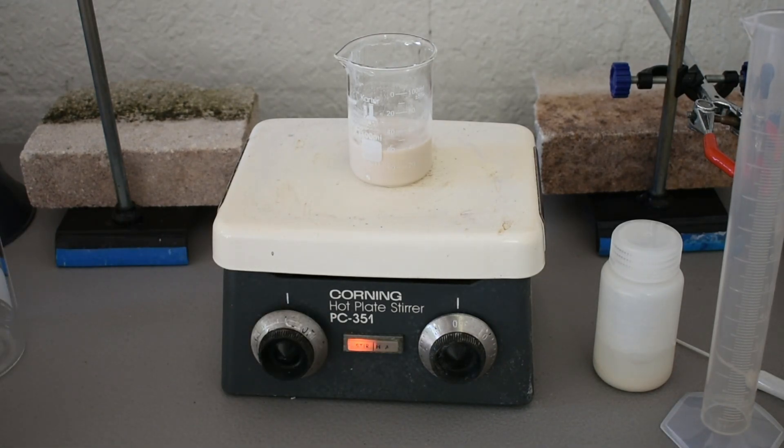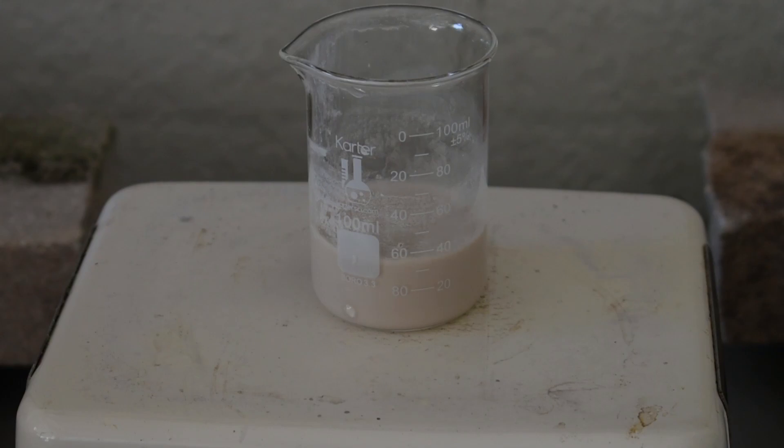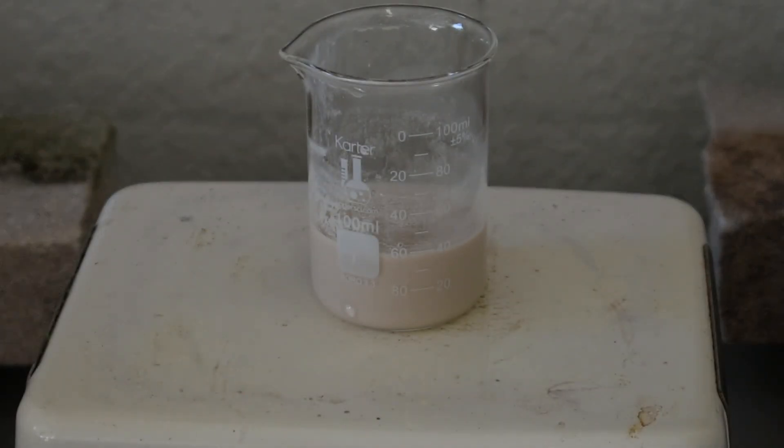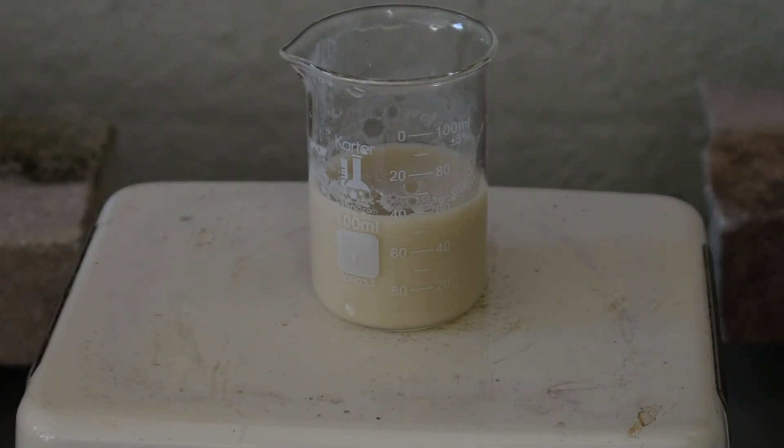And then we're going to move the camera a little bit and zoom in. We're going to add our pyridine and acetone mixture right here. We should see a white precipitate. We definitely got something. It is turning lighter. Looks like we got something good out of that. Now I'm going to leave this stirring for about five minutes, and then we'll go on to our washing steps.